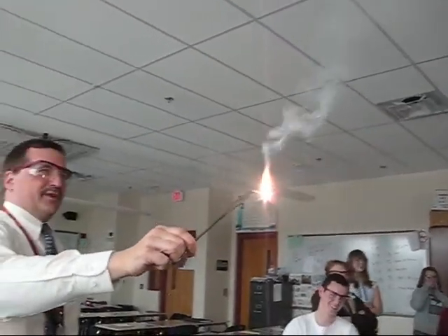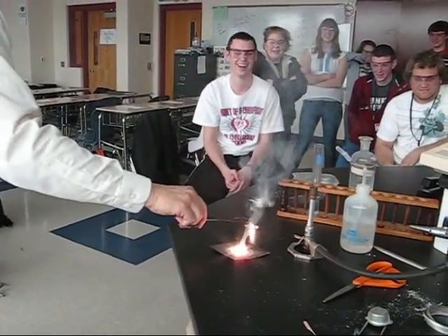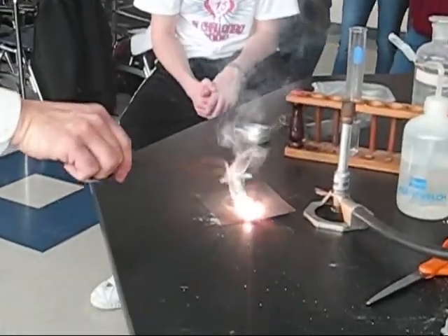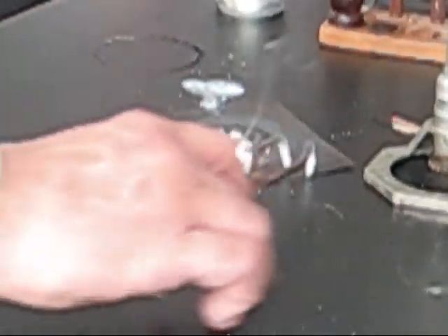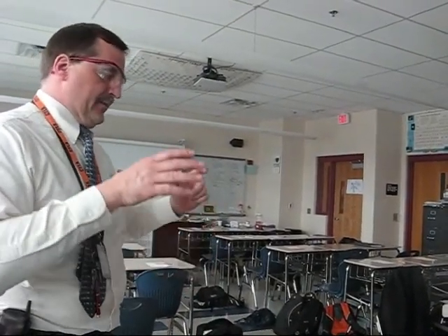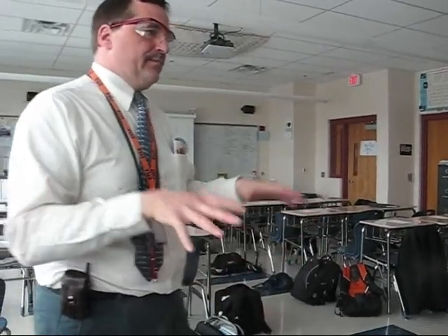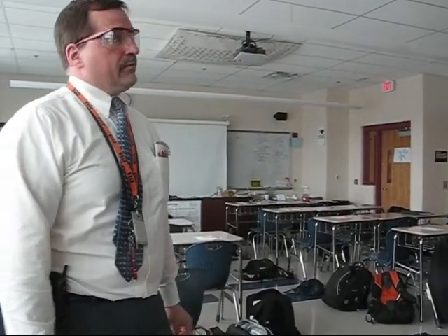There it is — behold! Magnesium alloys have been used because magnesium is very light and very strong, to make ladders and bodies for lawnmowers and things that benefit from light weight — you can hoist them around or push them. So if you have a garage fire and you've got a magnesium alloy ladder and it catches, it's trouble.